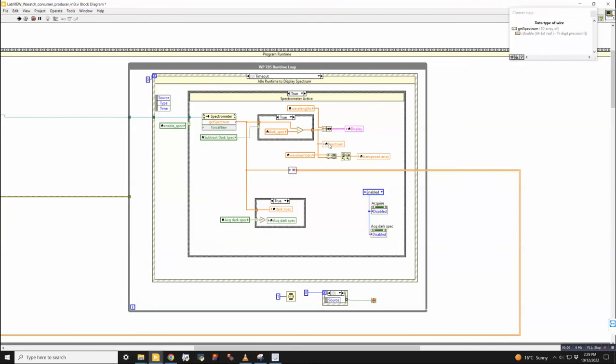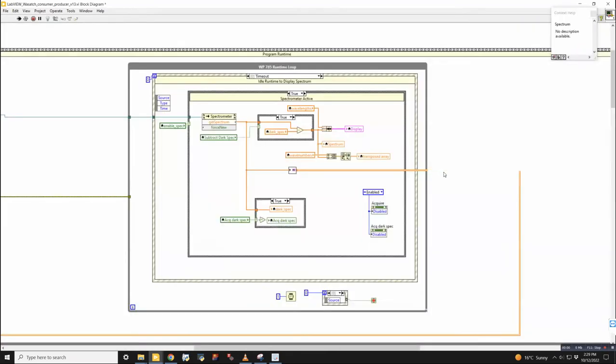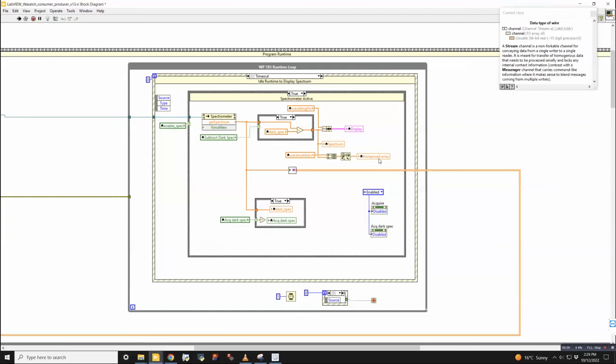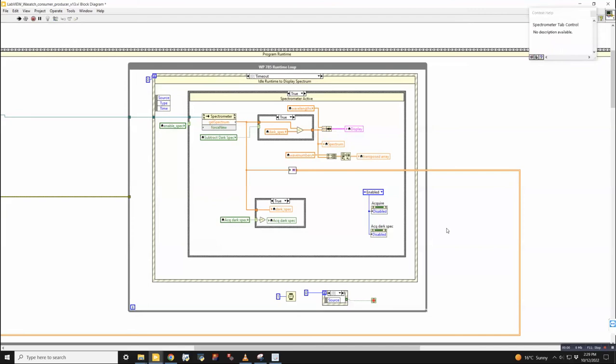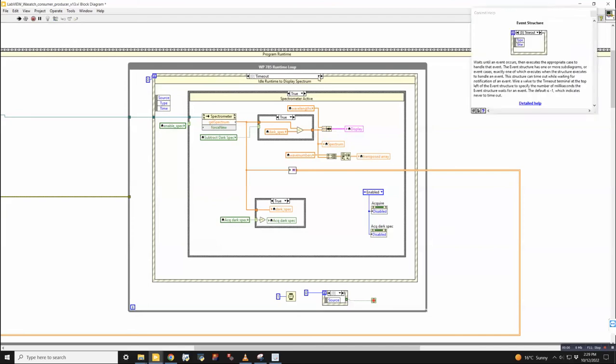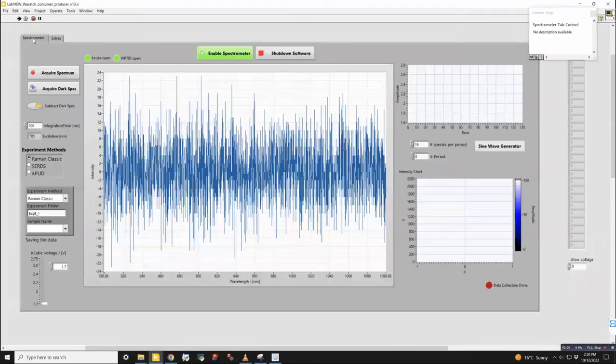We also feed that into a variable called spectrum, which is this one. And you can see it changing because the spectrum is always changing. This is actually a 1D array, but it's just been truncated because you don't need to see all of it all the time. And then into this transposed array with wave numbers, which is used maybe down the line for something. So the other case for the spectrometer is if you want to change any settings. And pretty much the only setting that you can change is the exposure time or the integration time. So this case here responds to when there is a value change here.